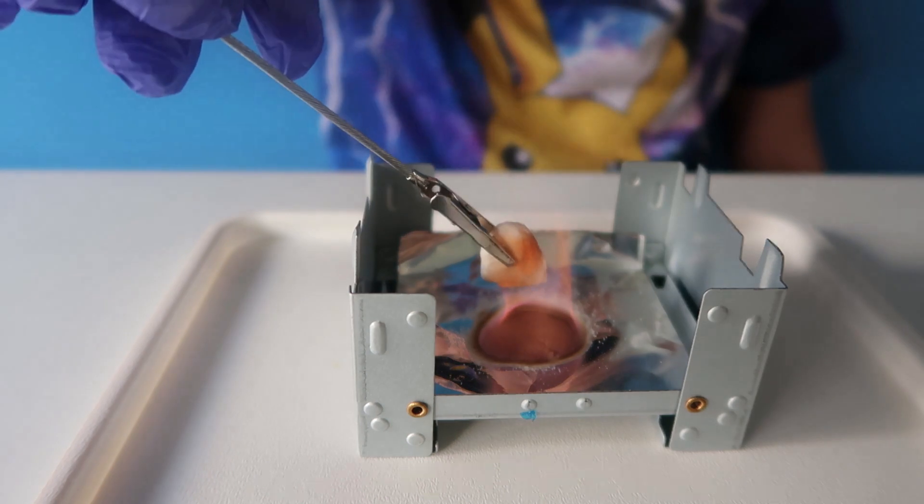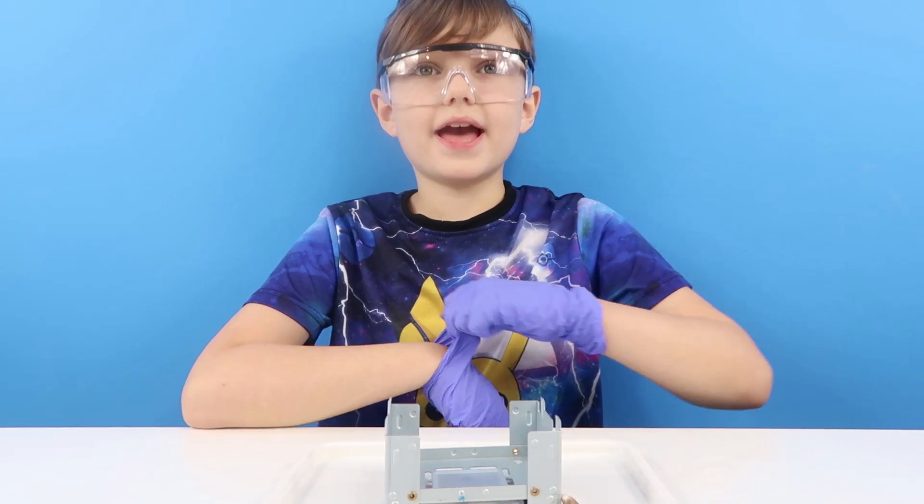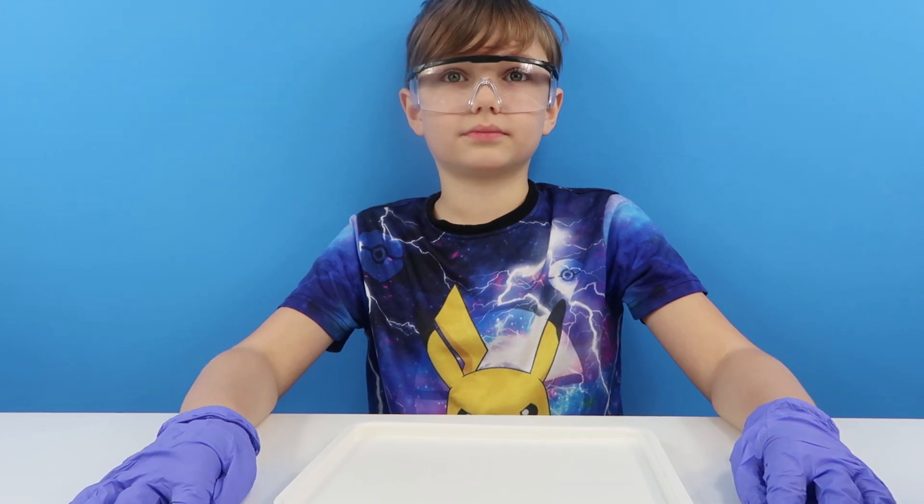Can you see it's beginning to glow? There we go — you can just see it there, it's glowing. So should we move on to the next experiment? Yeah. So the next one we're making is this then.